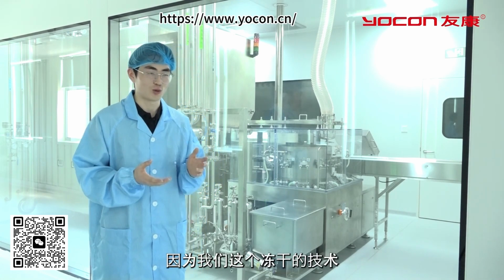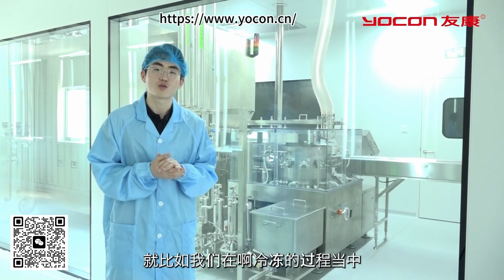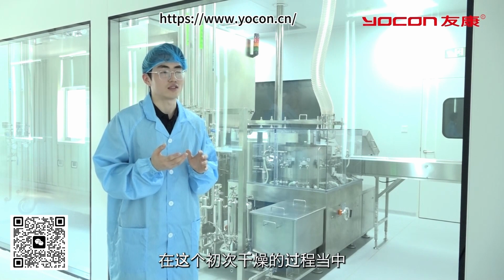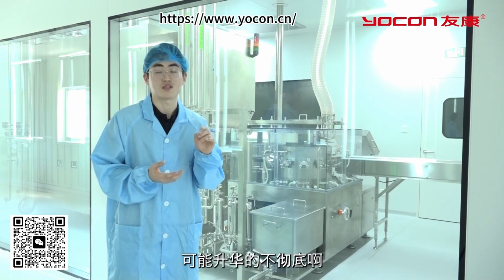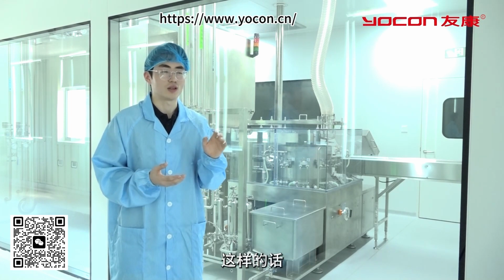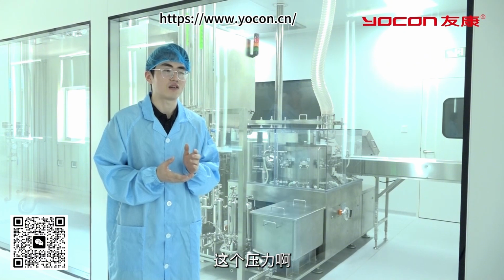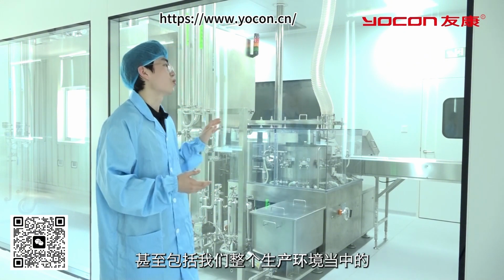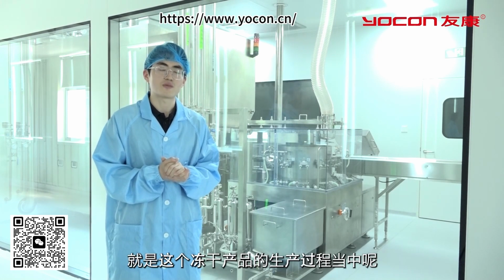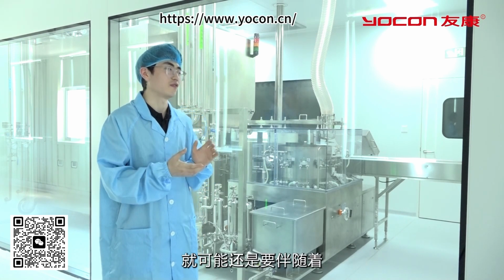On the contrary, the equipment and technology requirements for freeze-drying production lines are very high. Let me outline a few key points for you. For instance, the cooling rate during the freezing process affects the size and distribution of ice crystals. During primary drying, some large ice crystals may not sublimate completely, or small ice crystals may dry excessively, both of which can impact the final product quality. Moreover, the temperature and pressure during the sublimation process, as well as the humidity and air cleanliness in our entire production environment, all affect product stability. Therefore, every step in the production of freeze-dried products is crucial, and attention must be paid to every detail.